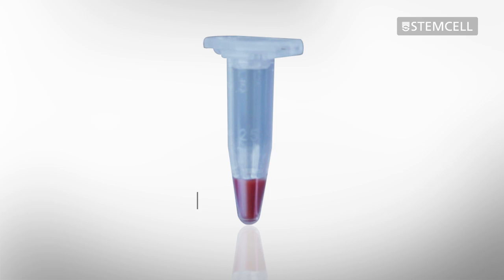When aspirating the upper phase, it is important to ensure that you don't disturb the RBC pellet.